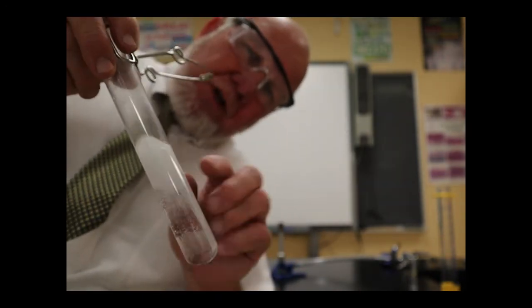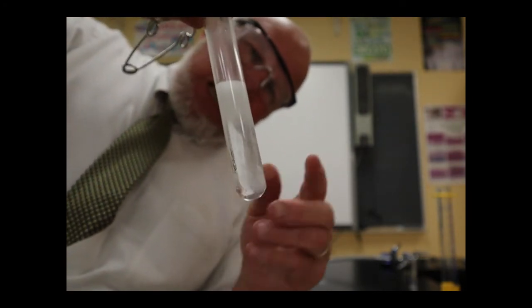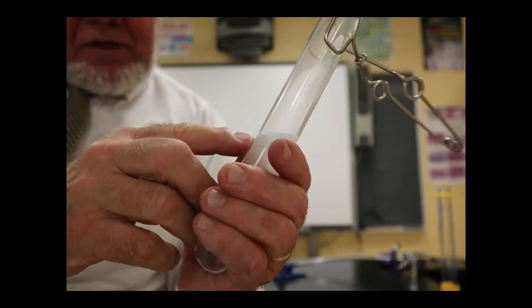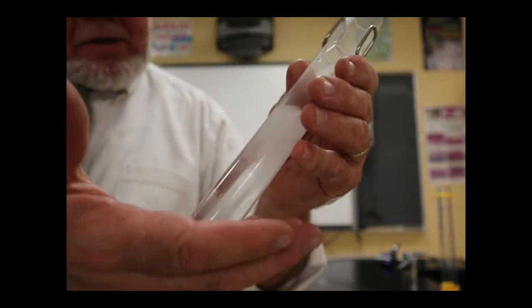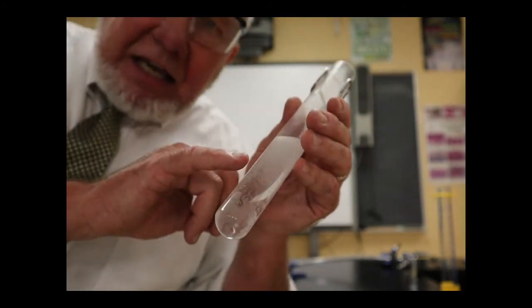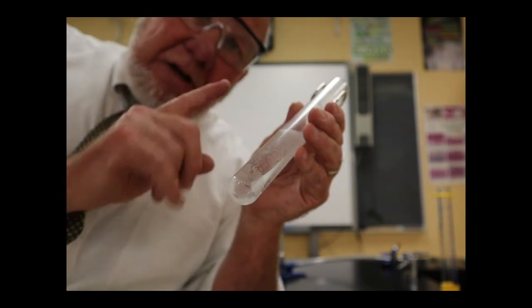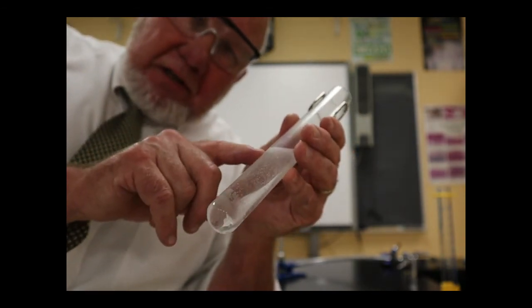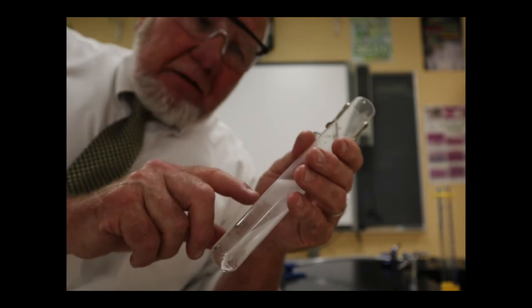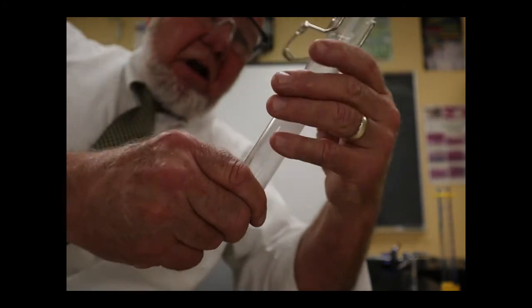So if I know I've got 0.25 grams of magnesium here, I know how many moles I put in here to begin with. Well, when I get rid of all this water, which is looking good, very little, just a little bit up here, let's see if I can shake it up. If I get rid of the water, then I'll have the magnesium chloride in here. I can get the mass of the magnesium chloride that I made. So for the 0.25 grams of this, I should be able to figure out, before we actually get the final result, how many grams I should be getting. That's called the theoretical yield. How much I actually get will be what's in the test tube, which we call our actual yield.